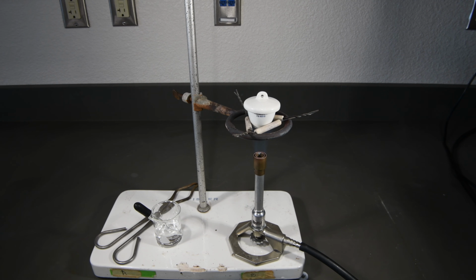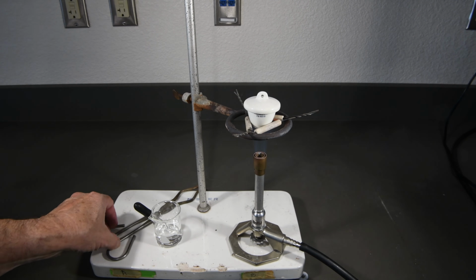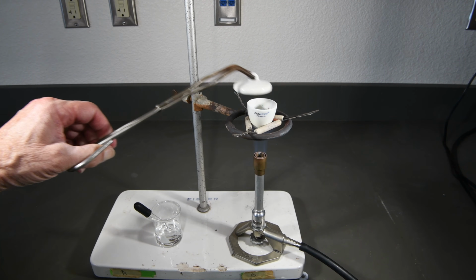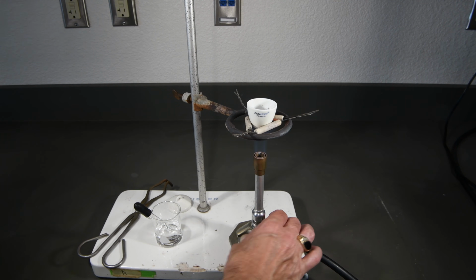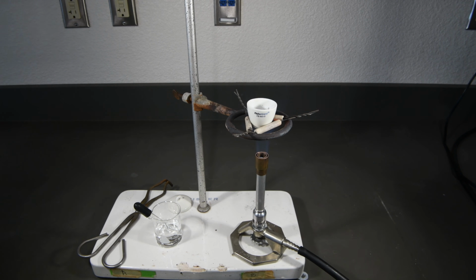magnesium oxide. We've been heating the crucible now for about 1 minute. So all of the magnesium nitride should have been converted to magnesium oxide by now. So we'll turn up the flame and heat the crucible for several minutes until all of the water has been removed, and then we'll be able to go ahead and get a final mass of our magnesium oxide. The crucible's been heating now for several minutes, so all of the water should be evaporated by now. So we just need to turn off the burner and let the crucible cool down.